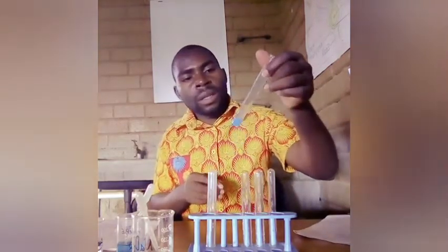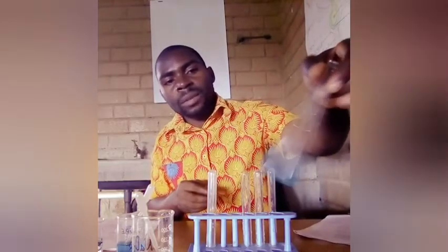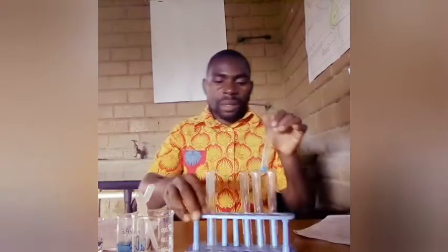As you can see in this, certain things have been formed. I can see some crystals that are being formed, and also the color itself. So now, how do you get the color nicely? What we are going to do is this.